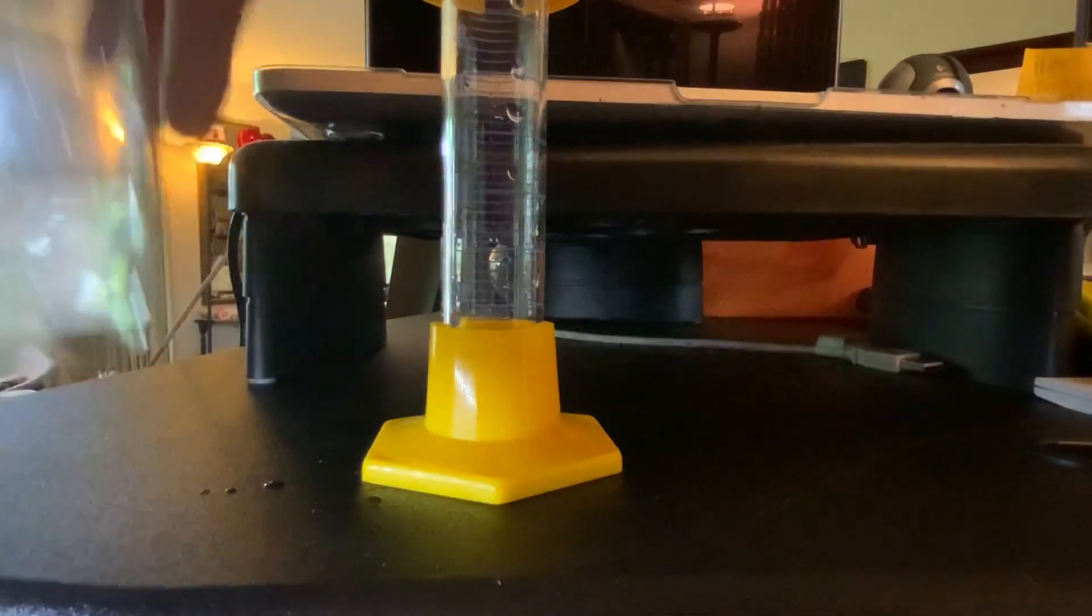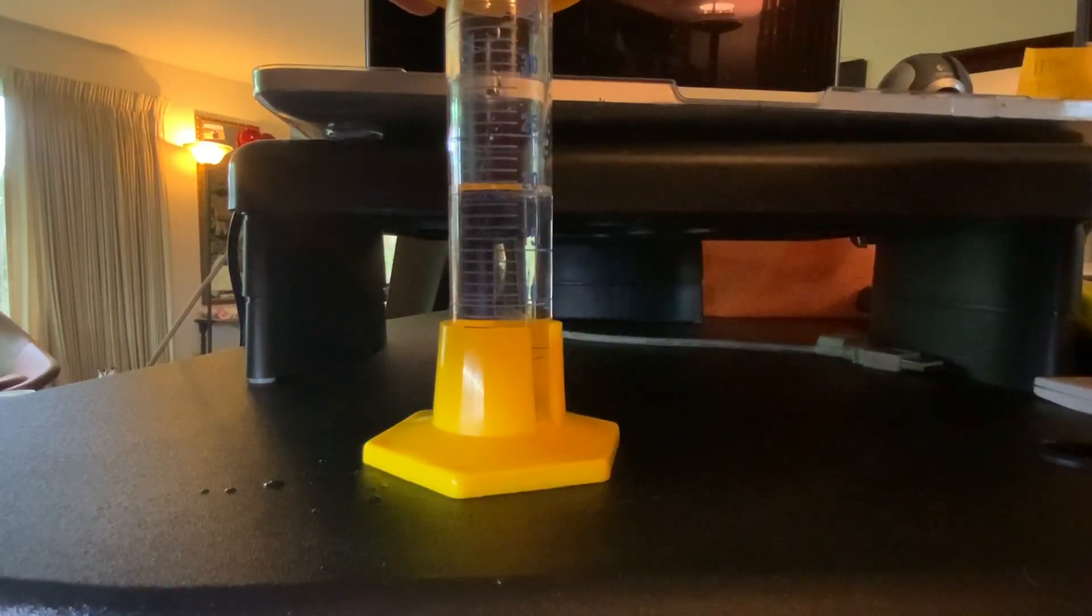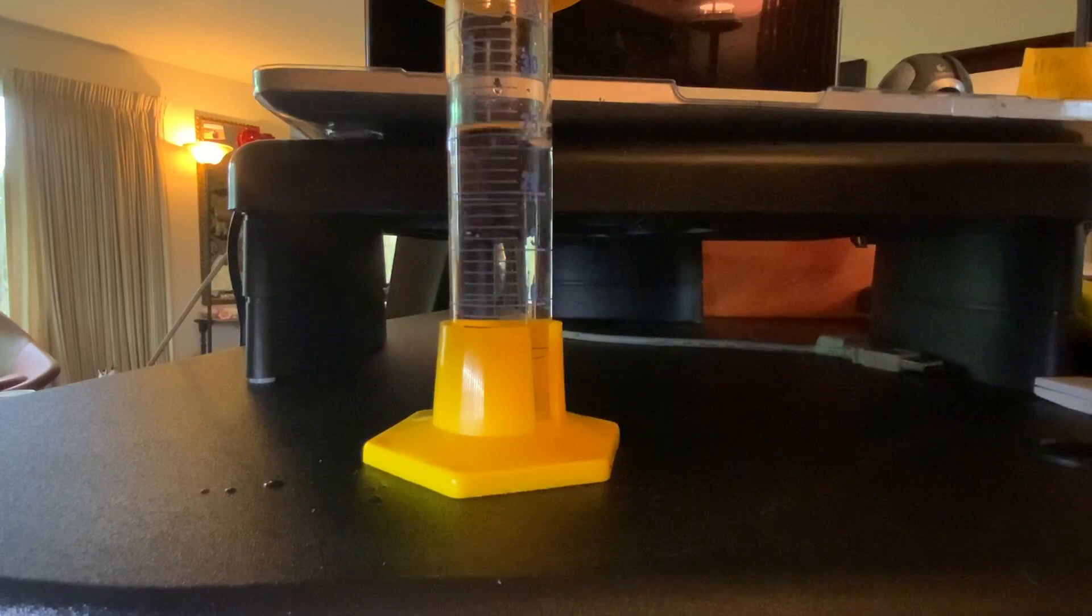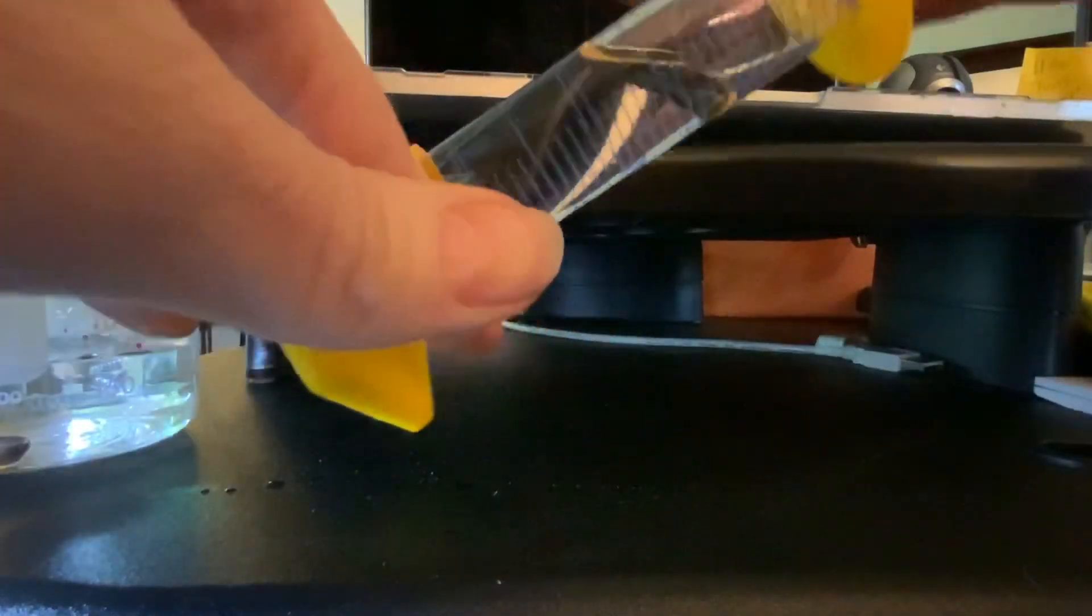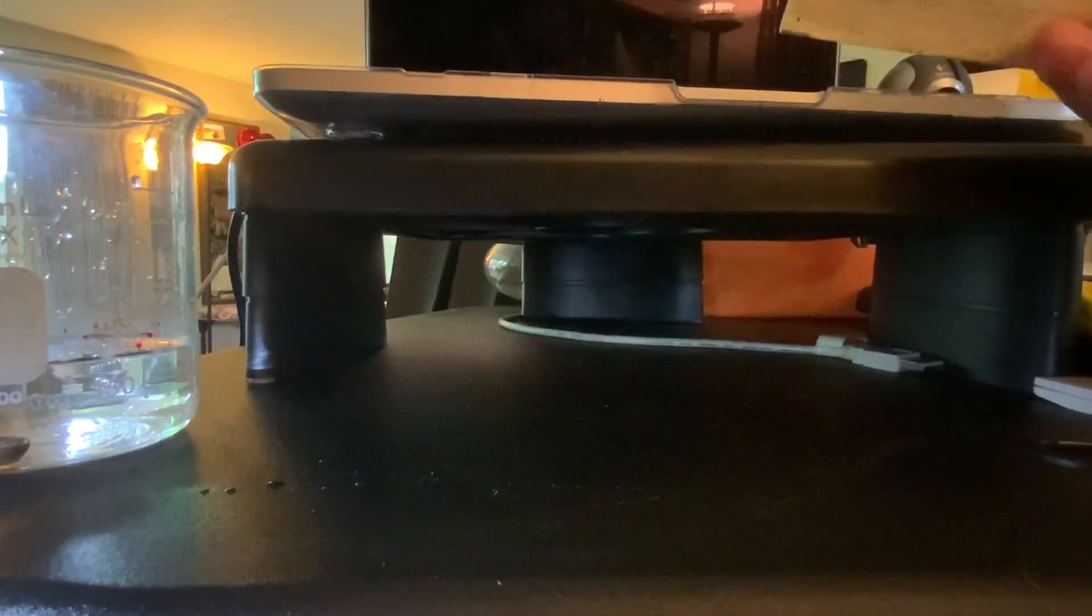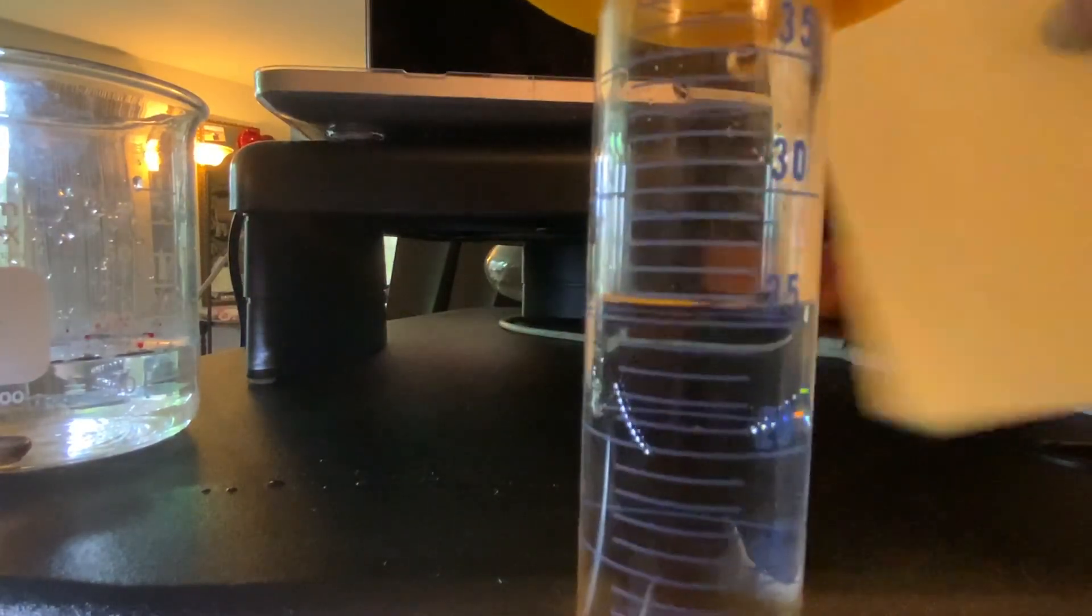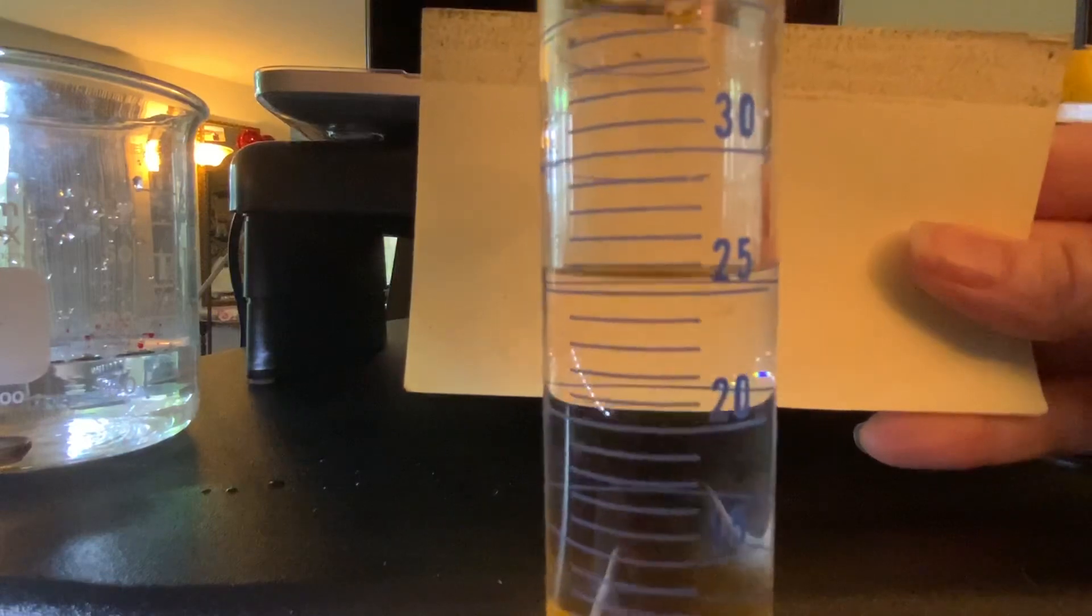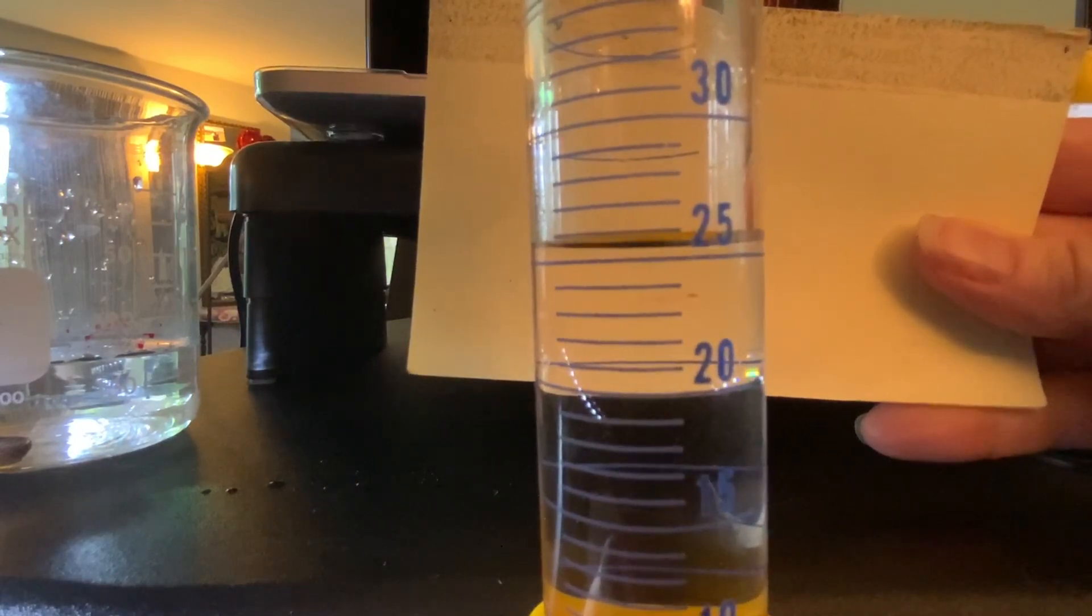Alrighty, I'll add some water. I'm going to bring that down in front of the camera for our initial measurement and then I will put the pennies inside there.